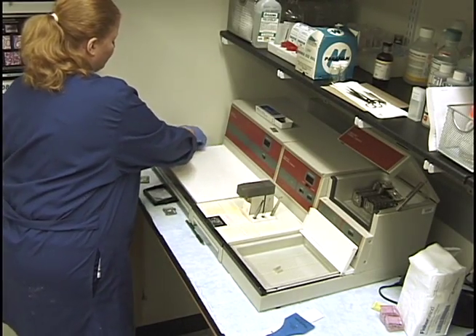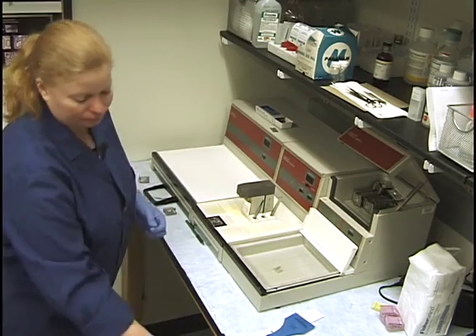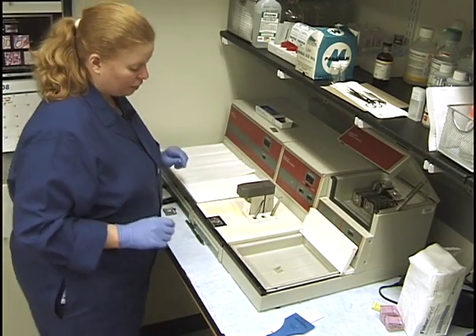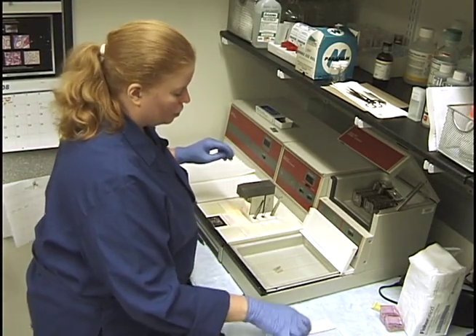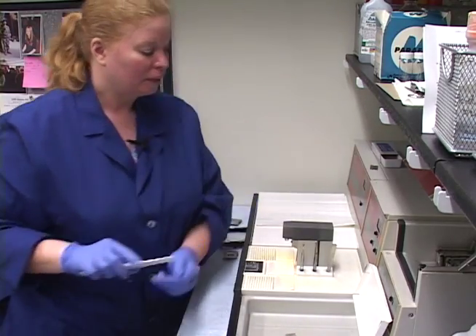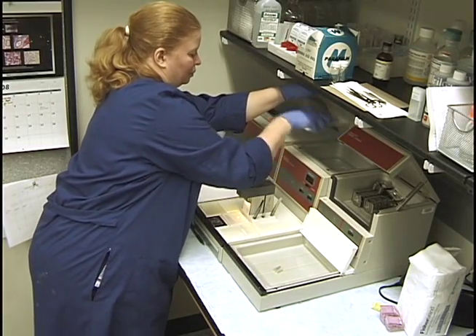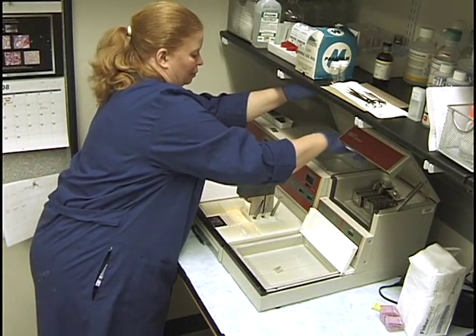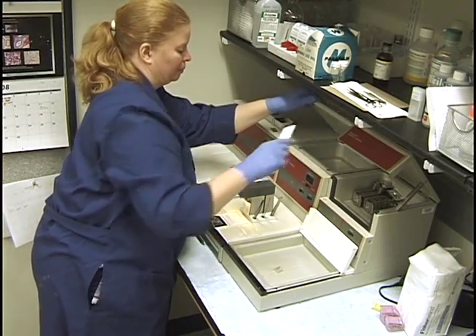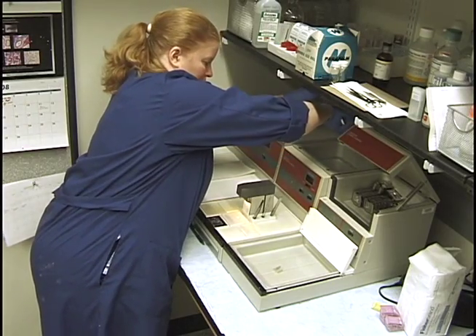These little edges here get a lot of paraffin stuck in there - there's not a lot you can do about that, but once in a while I brush it out. There's a lot of moisture there, so I take these scrapers and scrape all this. When I was adding paraffin, some of it got on the lid, so you can get some of that off. I just scrape all around and keep it nice and neat.